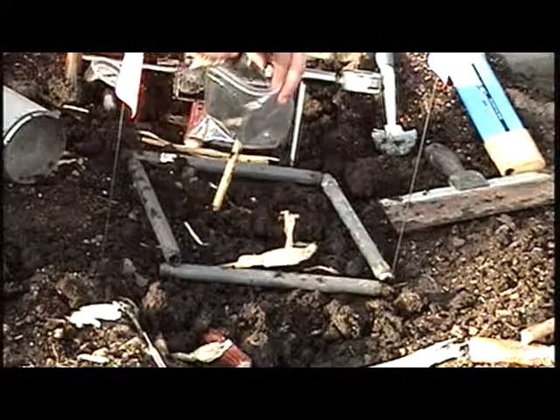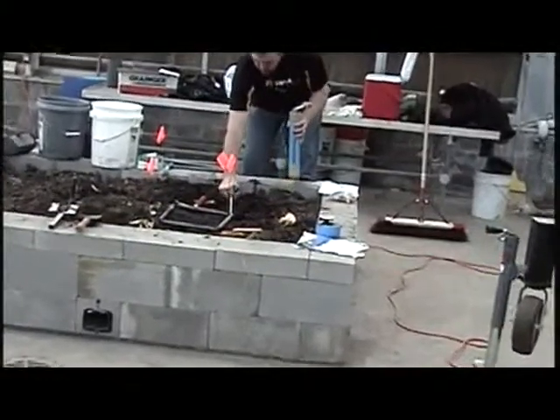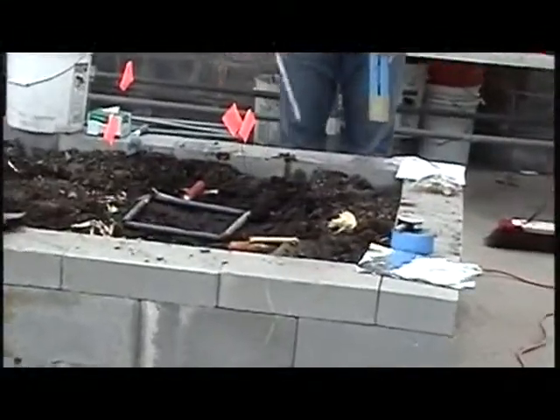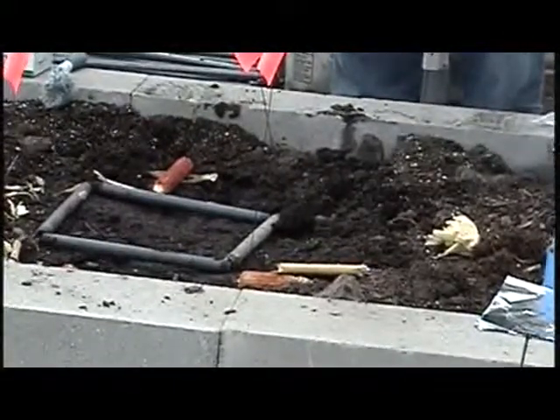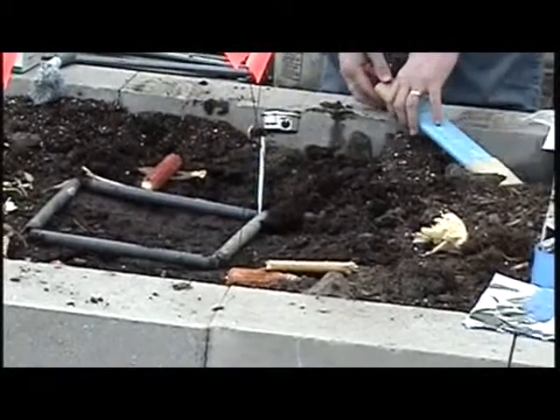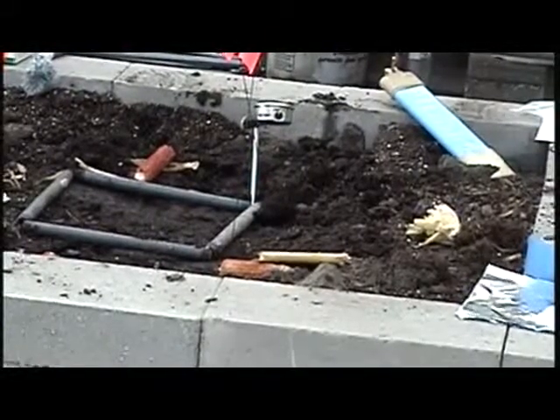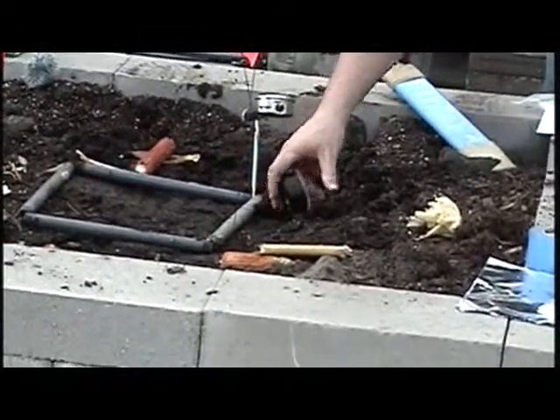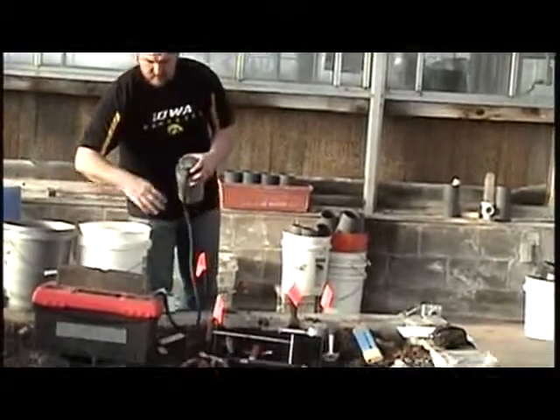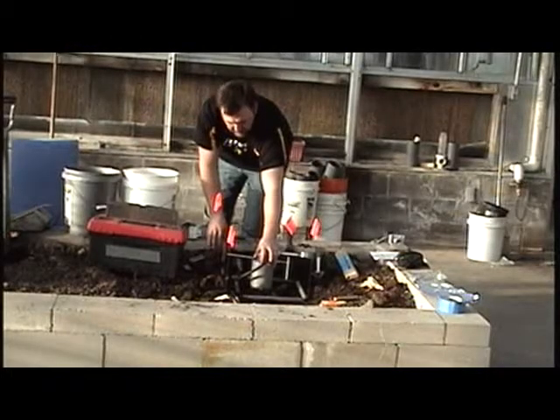After flagging and recording the site location, researcher 1 will carefully remove any litter or organic material and place it in the appropriately labeled bag. Next, researcher 1 will collect soil moisture and temperature using a soil moisture probe and thermometer. Researcher 1 is also responsible for taking CO2 flux measurements using an infrared gas analyzer.